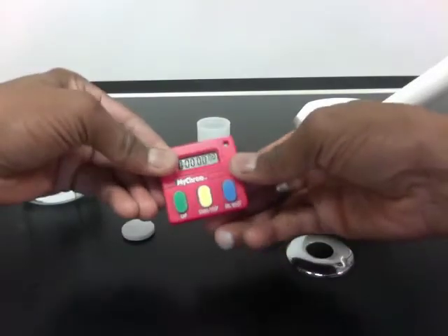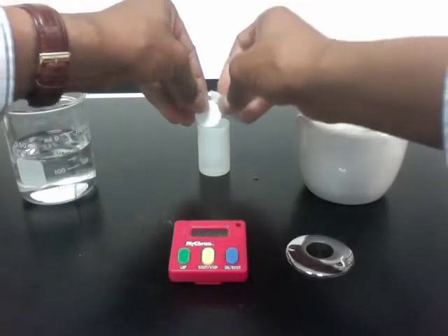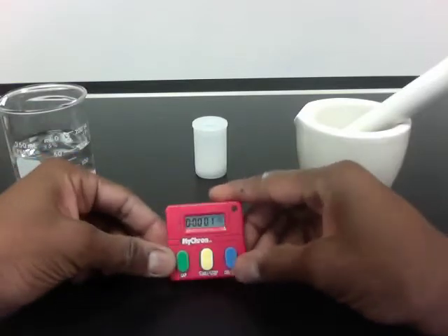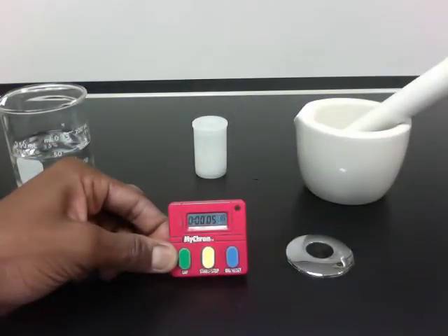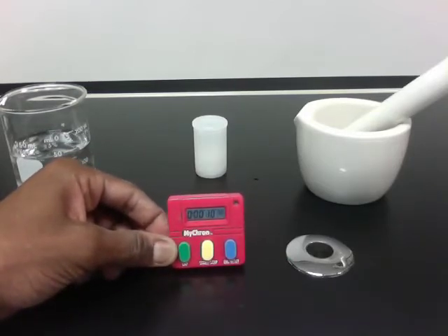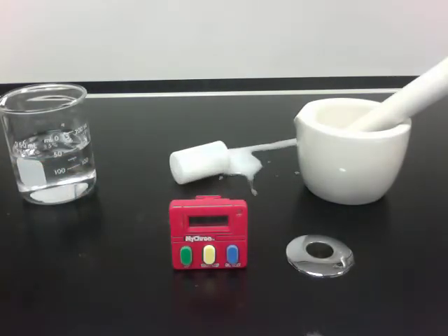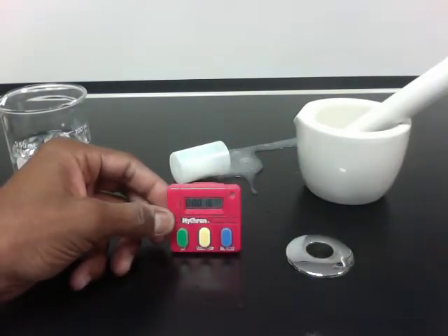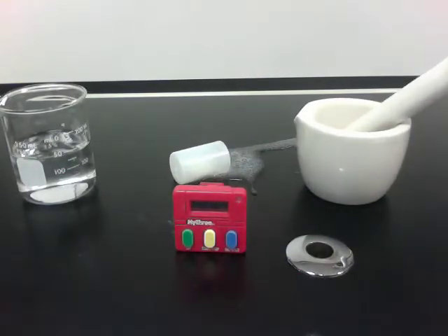It would be nice if I had four hands, but we'll use what we have. All right, here we go — ready, set, drop. Okay, well that was about 16 seconds. That was pretty loud too. Let me clean up, and then we'll do the second trial.